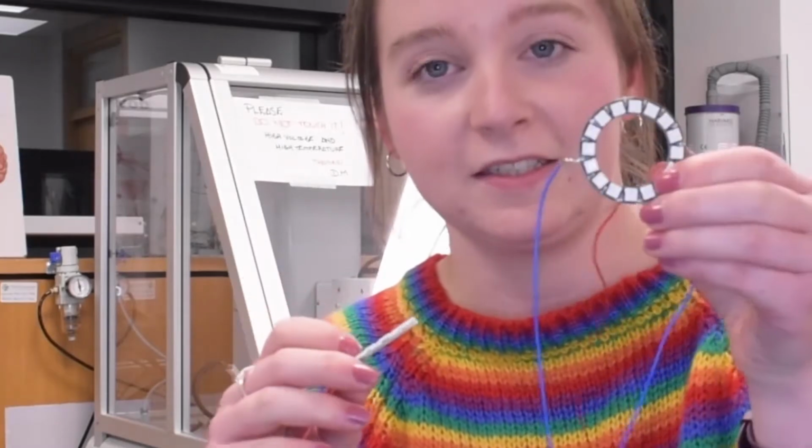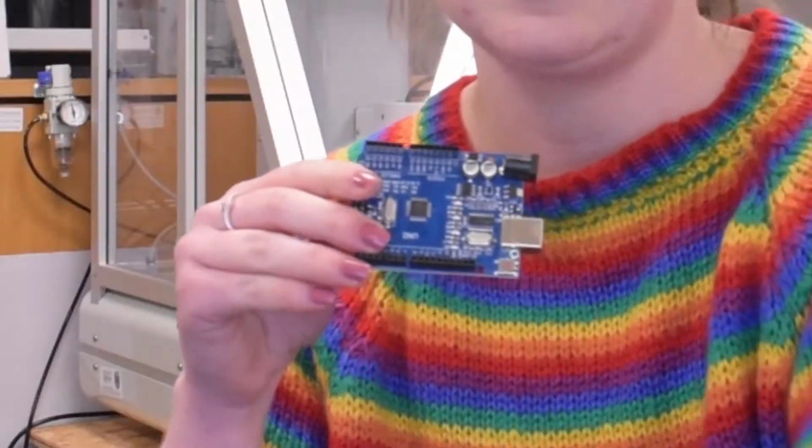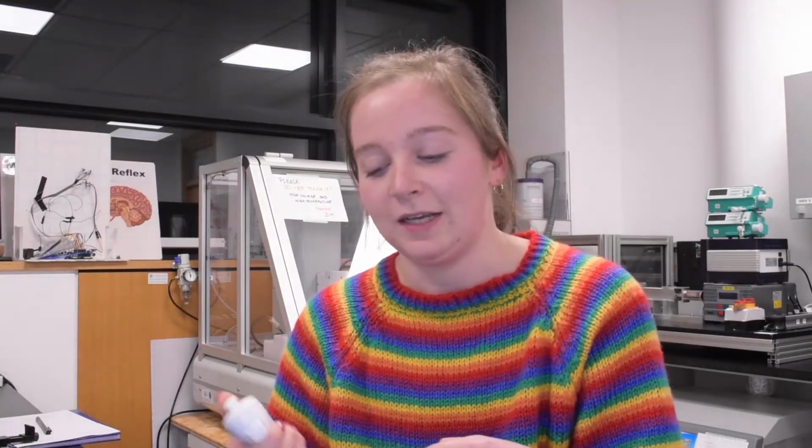So the next thing we're going to need for our experiment is to be able to control some lights, and then we can record how our animals will respond to these lights. So the lights we're going to be using are these pixel rings. You can get them in different sizes. This is 16 pixels and this is 12 pixels. And to control them, we're going to be using an Arduino. This Arduino will send signals to the lights and switch them on or off, and also change the color. And the last thing we're going to need is we want to be able to control these lights ourselves. So we're going to wire up a Nintendo Wii nunchuk, and this will be able to turn the lights on and off, decide which pixels are on, and change the color.